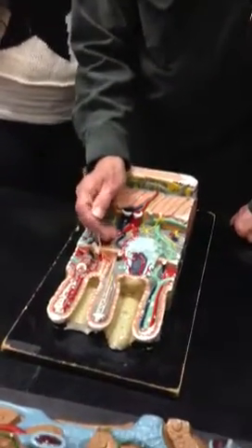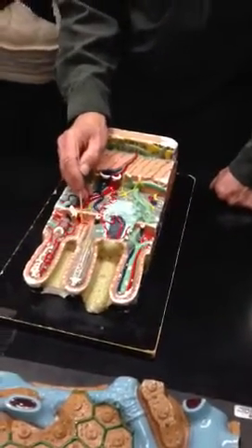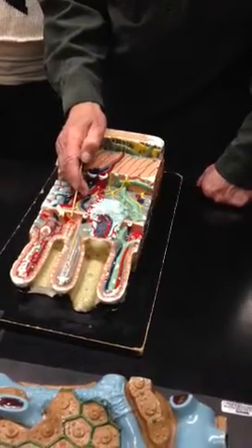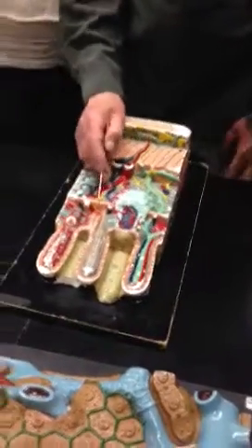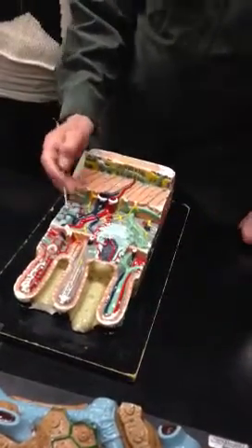Down here, this red thing, you see this depression, these red things down here? Those are Paneth cells. Paneth cells are especially able to phagocytize bacteria, debris and stuff that leaks in. So this is part of our immune system. This protects us from all the bacteria from the food and junk that we eat, from sucking our thumb and who knows what.